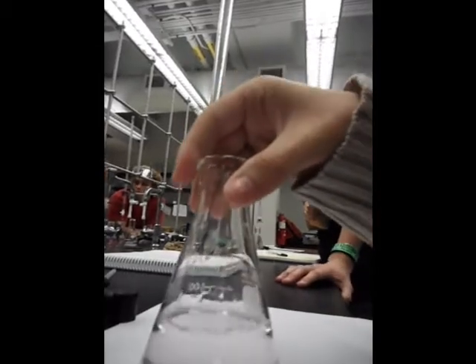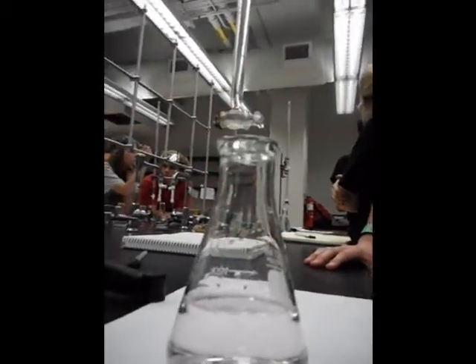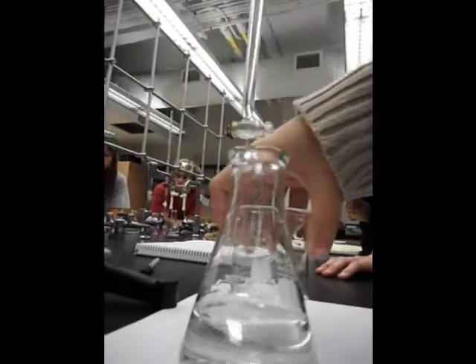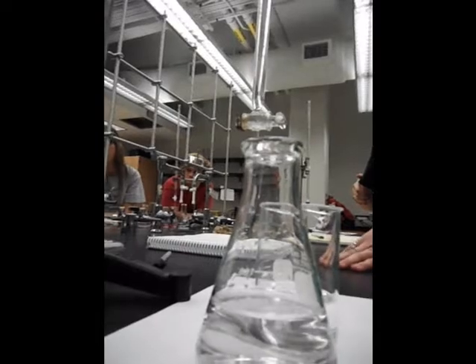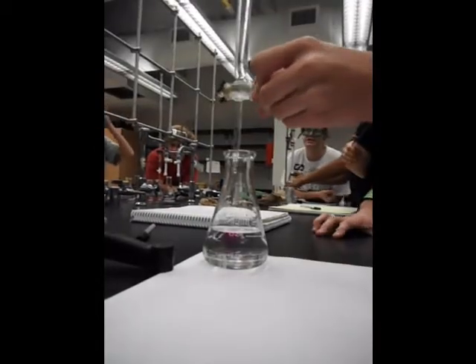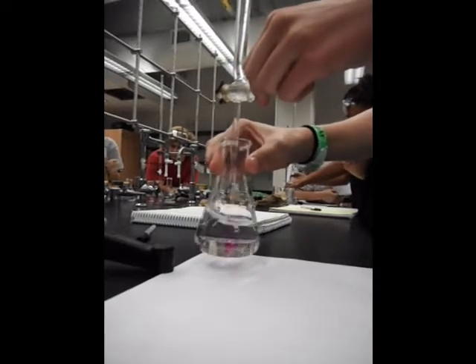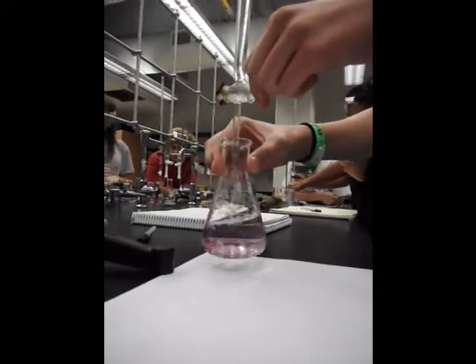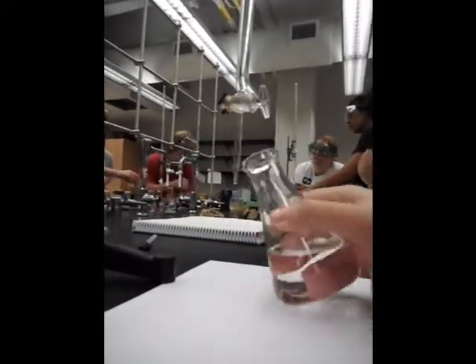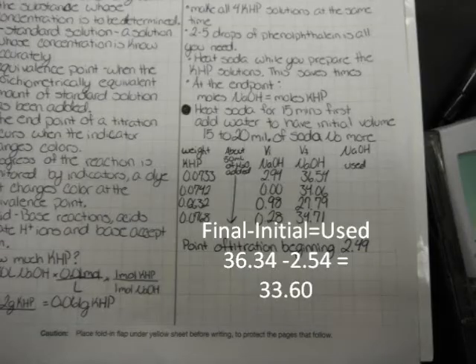For titrations, you are measuring the point at which the concentrations are equal, and you can also figure this out stoichiometrically, and that will give you the equivalence point. However, the equivalence point usually is not the endpoint because of error or such. And here you can't tell, but that is the pale pink.